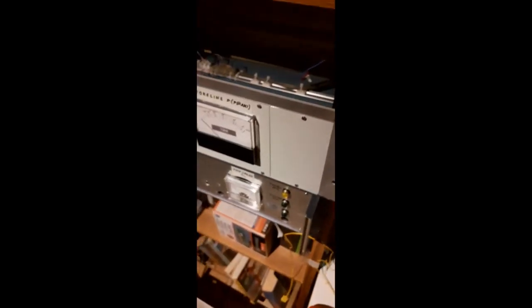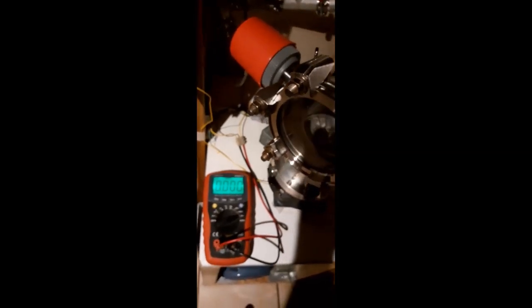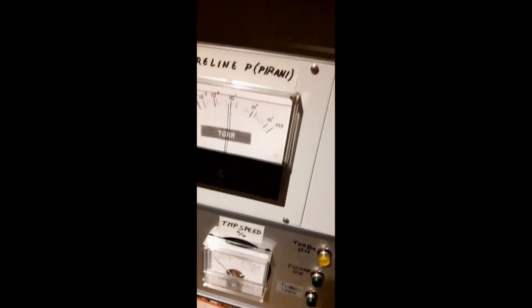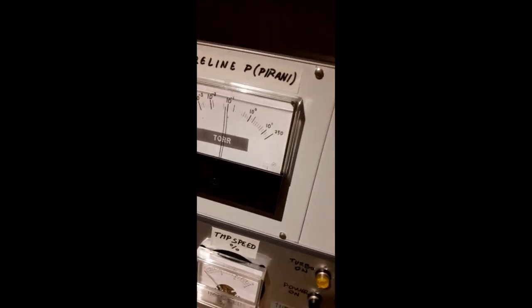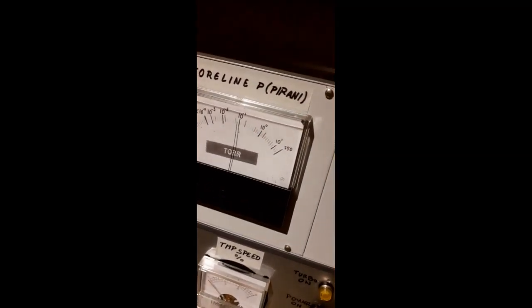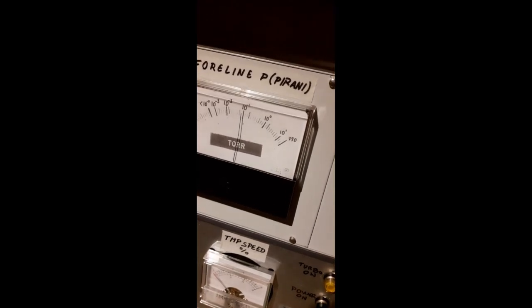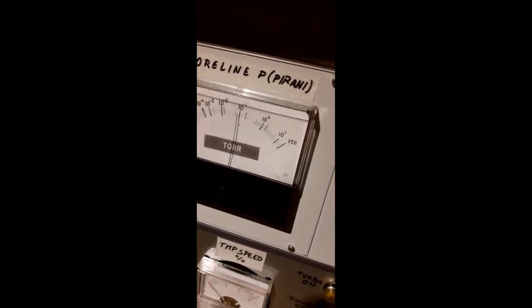So I guess I should show you how it works, or my procedure for starting it up. First of all, let's give ourselves the opportunity to monitor the power. Now the system has rough vacuum, and it holds the vacuum pretty well. I left it with rough vacuum overnight, and it stayed below 10 to the 0th torr. So I don't think I have any gross leaks. This is pretty good, actually.